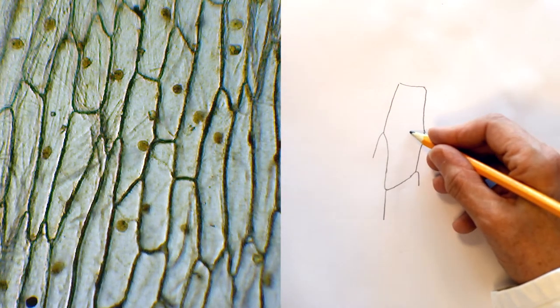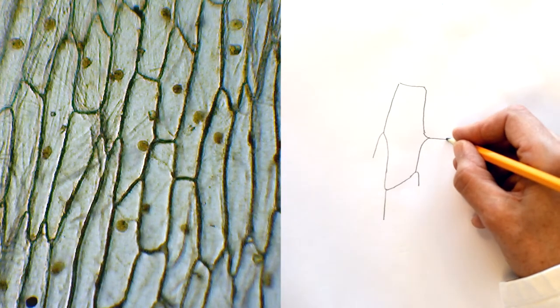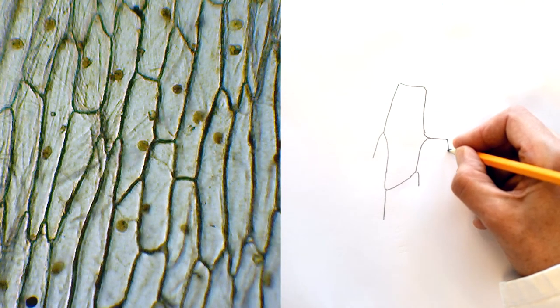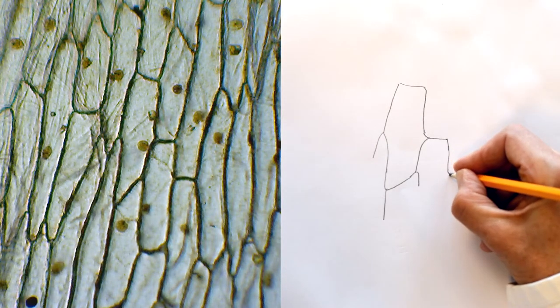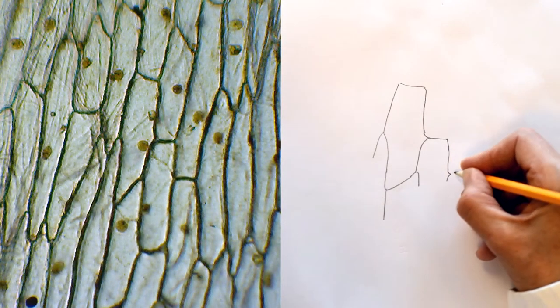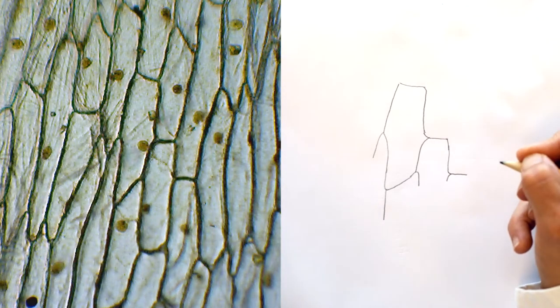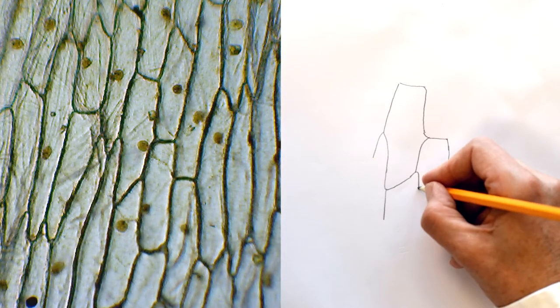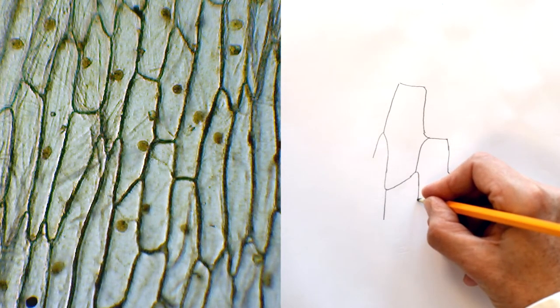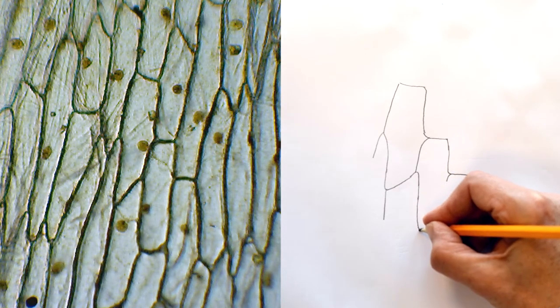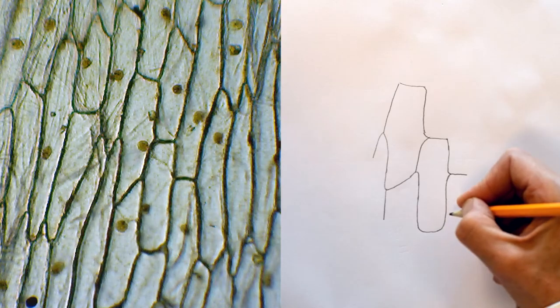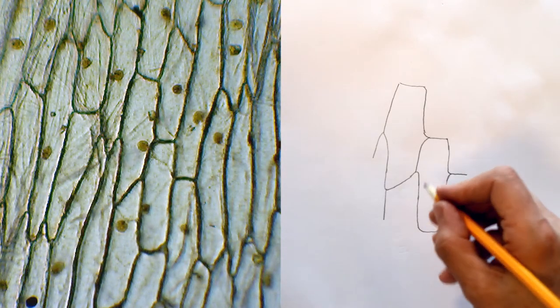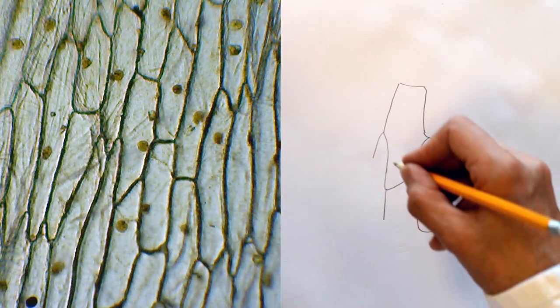So that cell is complete, I'm now going to draw its neighbouring cell and that cell too will be complete. But what I notice is as I come down about halfway down there's a little nick there where it interacts with the next cell to the side. Now I'm going to carry on down this cell and actually to be honest this cell is more or less except for those little details a rectangular cell. It is the cell that it interacts with which is of slightly different shape.